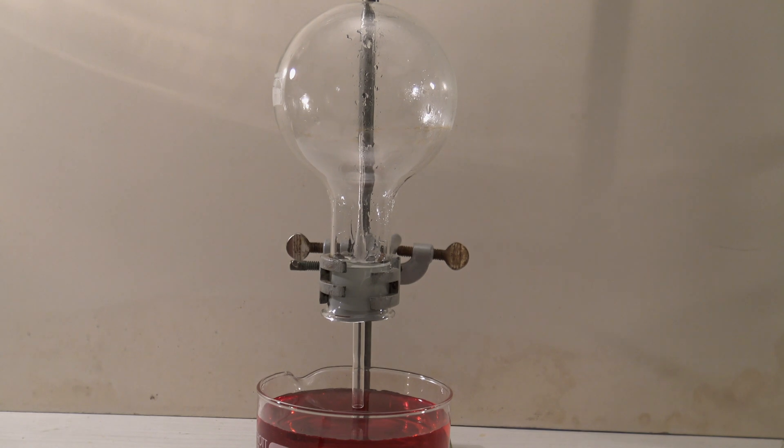Then the flask is heated with a hot air gun or with a water bath before attaching it to the ring stand.